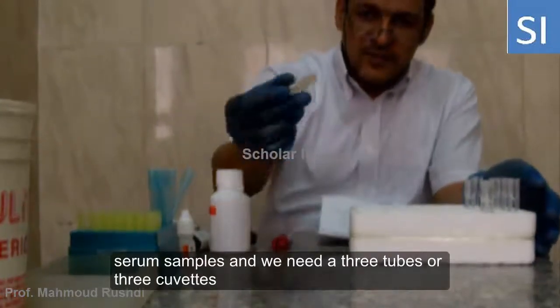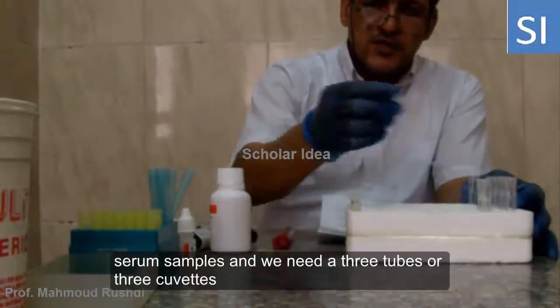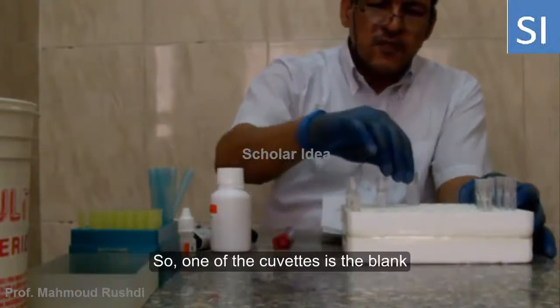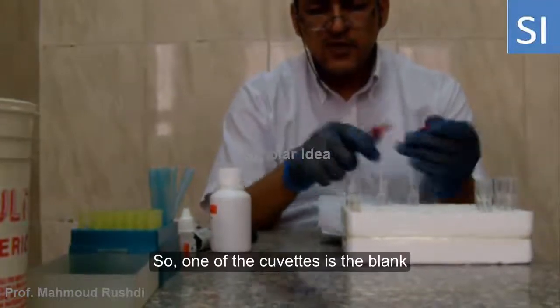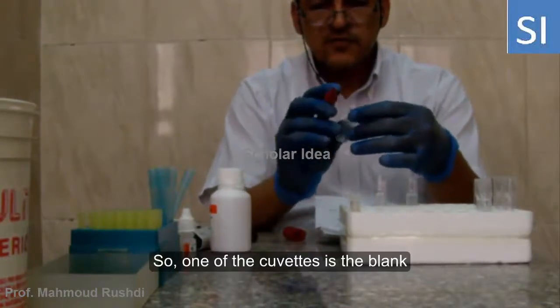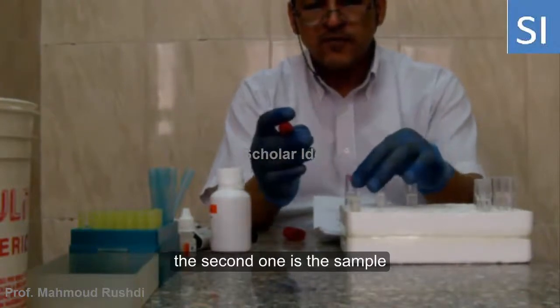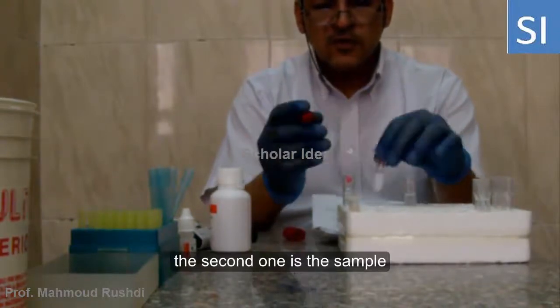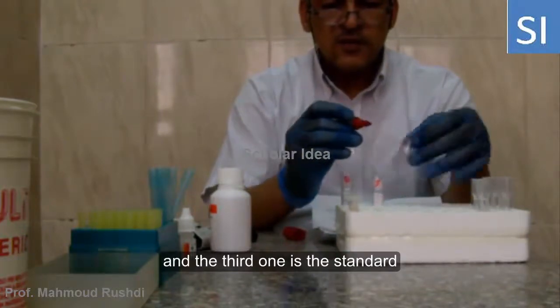So in order to measure glucose using a spectrophotometer, this is the serum sample, and we need three tubes or three cuvettes. One of these cuvettes is the blank. The second one is the sample tube, containing the sample. And the third one is the standard.